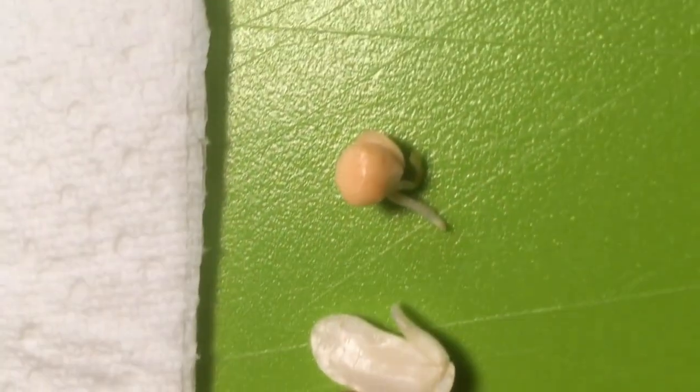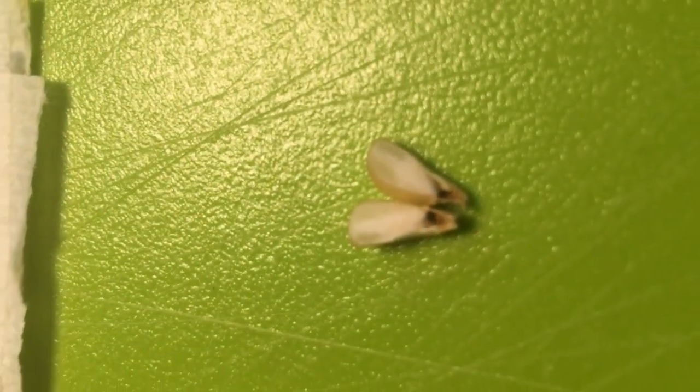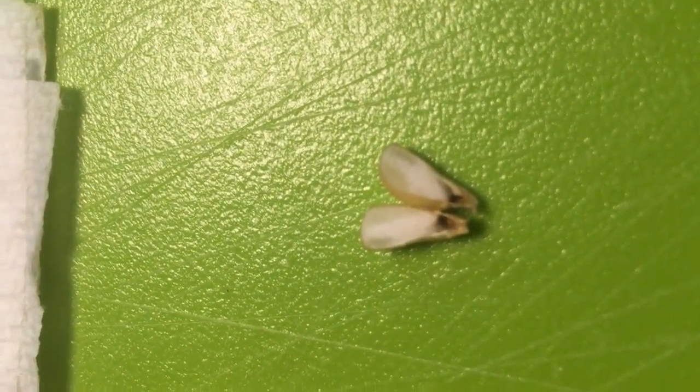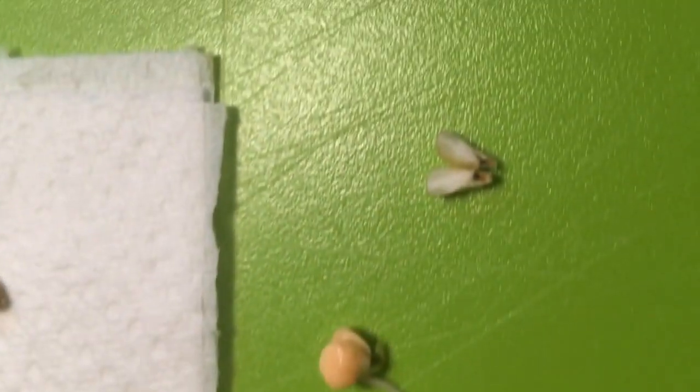So there is that corn seed, and notice it doesn't look like there was any real division there. These popped apart pretty easily. In fact, the split pea, that red lentil, was already sort of split apart, but this one does not look like it was meant to come into two pieces. But that's fantastic. We actually have two different kinds of seeds here.